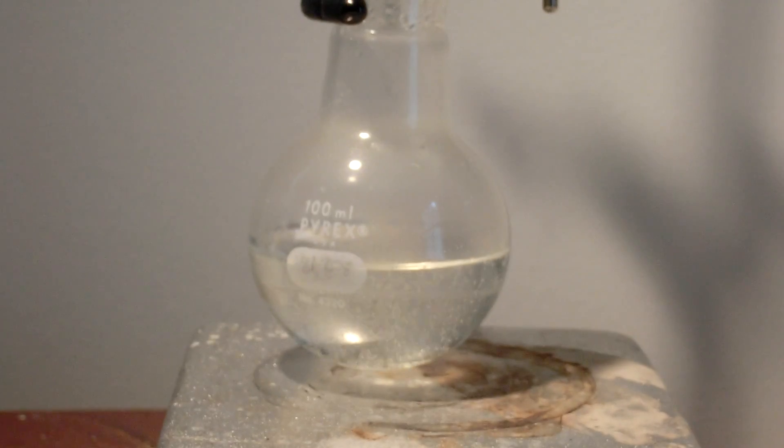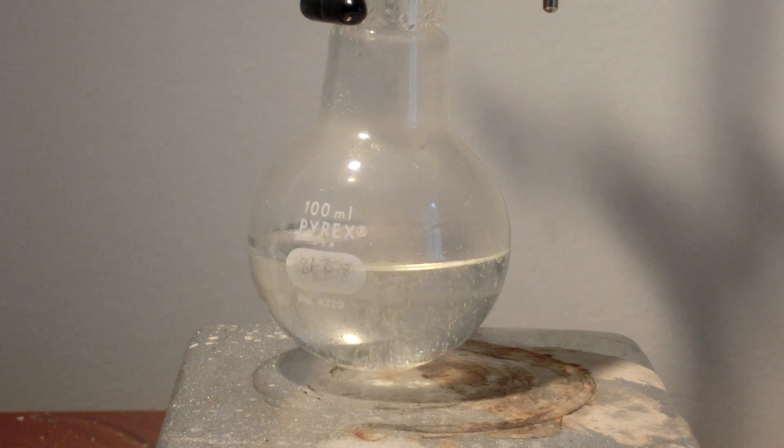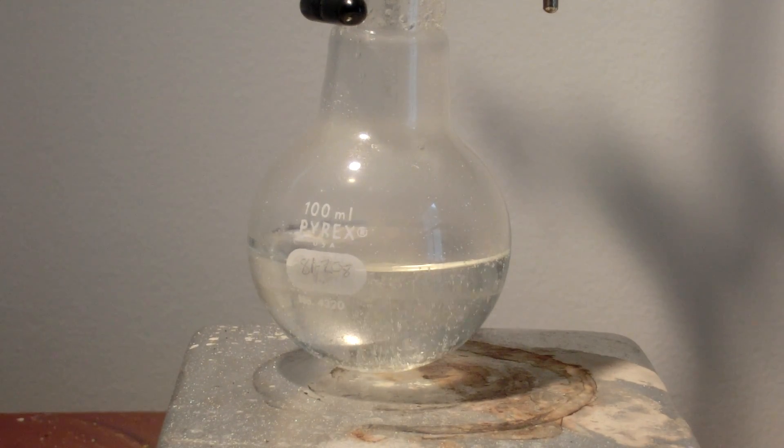Here's a video of the beginning of the distillation. During the distillation, lots of carbon dioxide gas will be evolved, but this is okay.